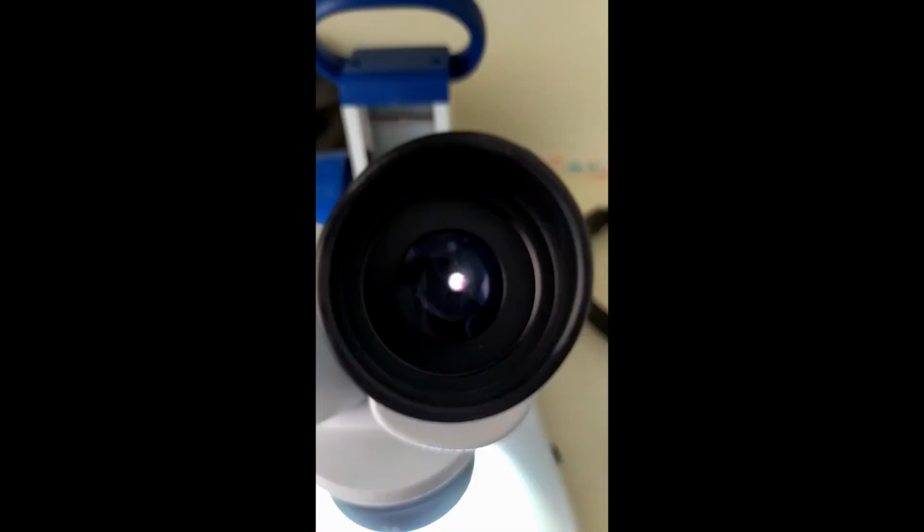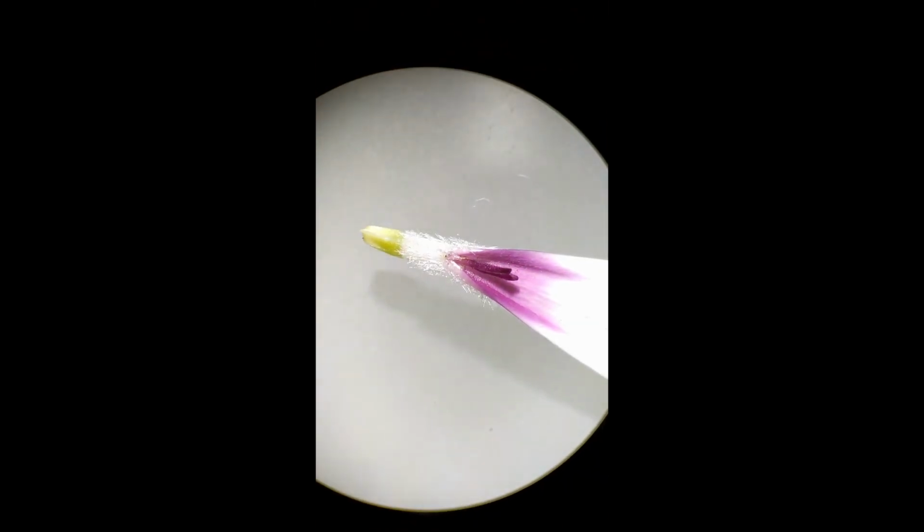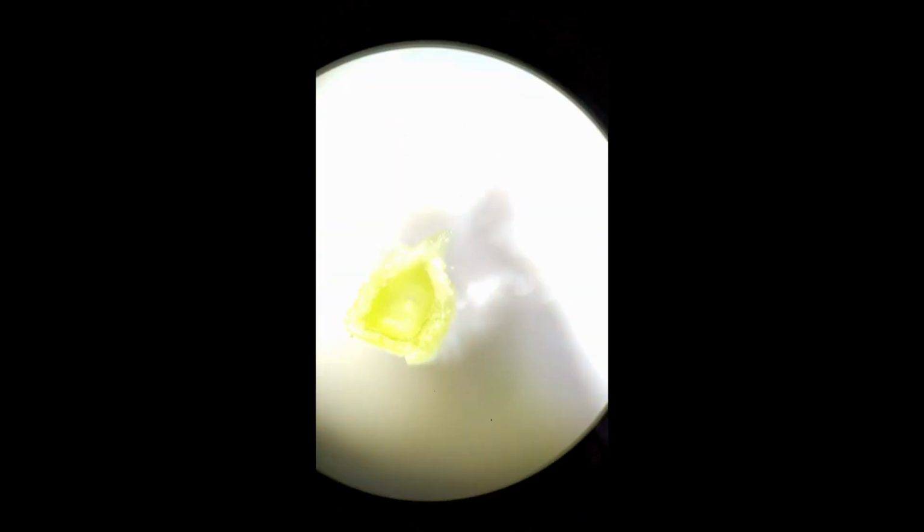Now, moving on to the bottom part of the flower, we can see the style and the stigma, 2 of them in fact, which would say that we have 2 carpels, but we're not certain until we cut the ovary with a razor blade, as I did here. Here we see that it only has 1 carpel. Please, if someone knows something better than me, correct me if I'm wrong, but I only saw 1. And yeah, that's pretty much the female part.